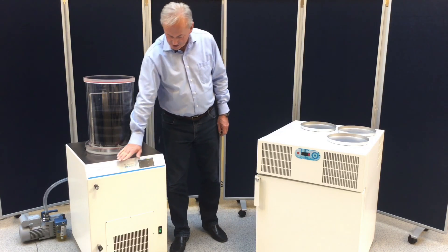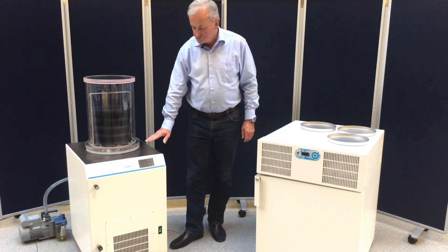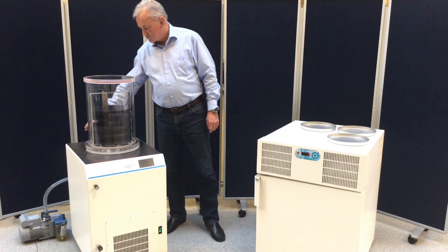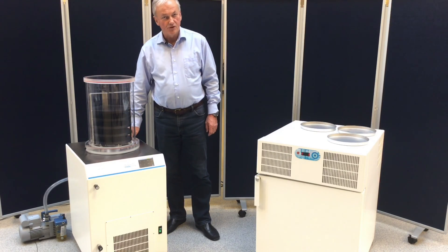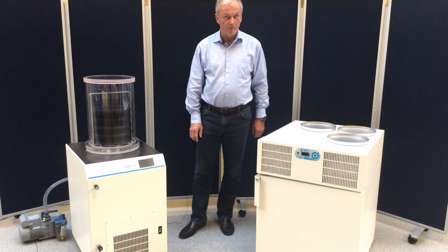At the same time we can start up the unit. It will take approximately one hour to bring the temperature down to minus 95 degrees and also heat up the vacuum pump, so we are sure that we are ready to do the freeze drying when our sample is frozen.